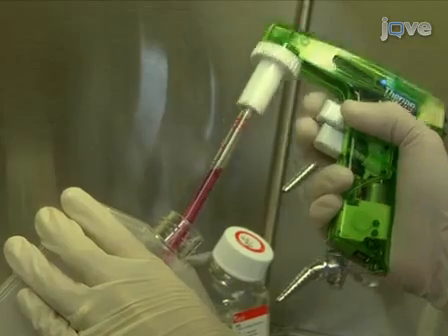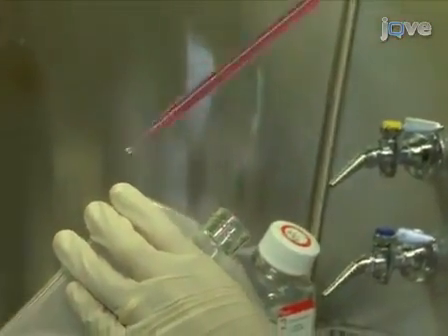Hi, I'm Adam McCoy, Senior Scientist at the Gene Expression Division at BioRad Laboratories. Today we'll show you a procedure for easily identifying the best electroporation conditions for transfecting primary cell lines. We use this procedure in our laboratory to study gene expression in these cells.